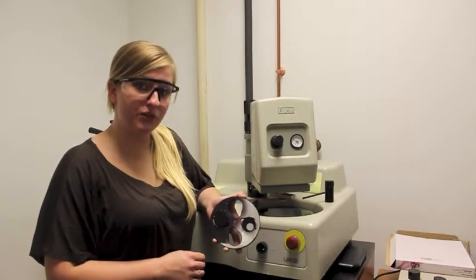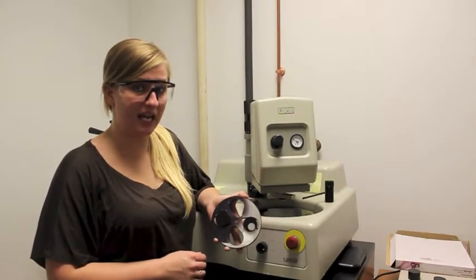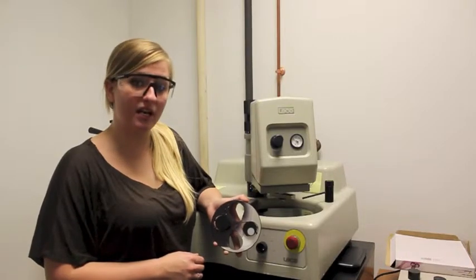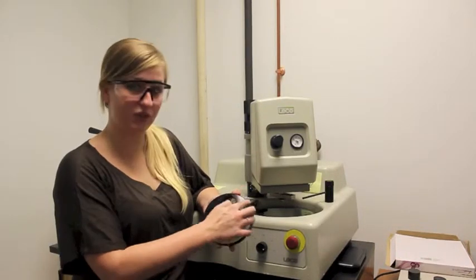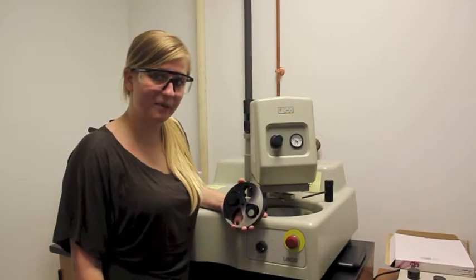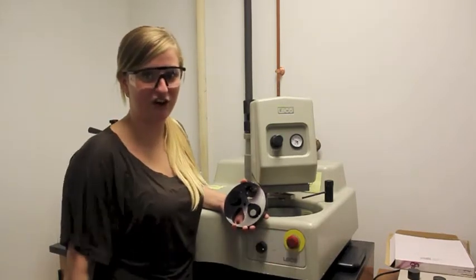During the procedure, you want to ensure that your table stays lubricated and the samples are protruding enough so you are not polishing the actual mount. Always clean up after yourself and push in the red button to turn the machine off.